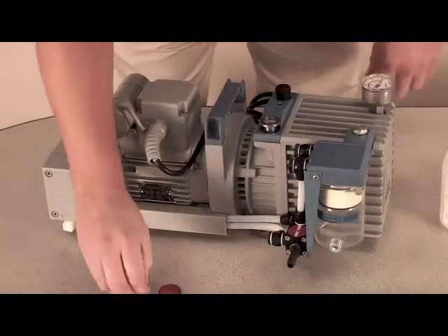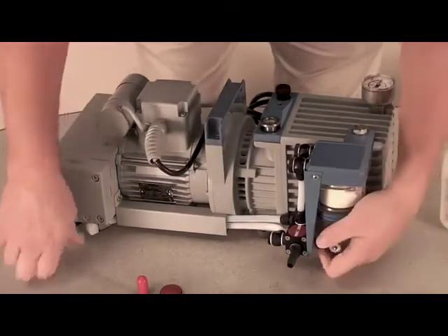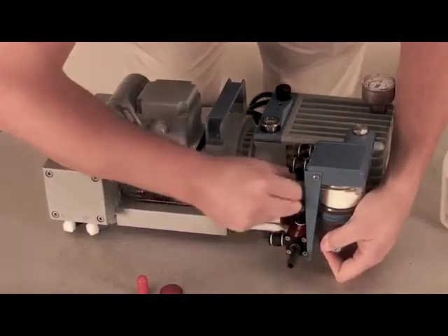Inspect the equipment for damage. If the pump is damaged, notify the carrier within three days.